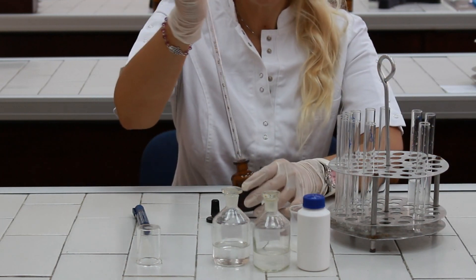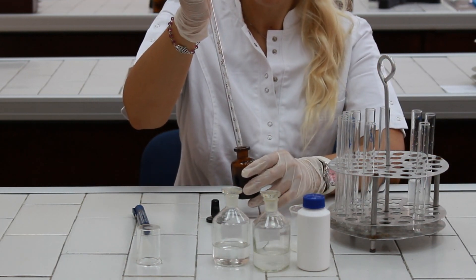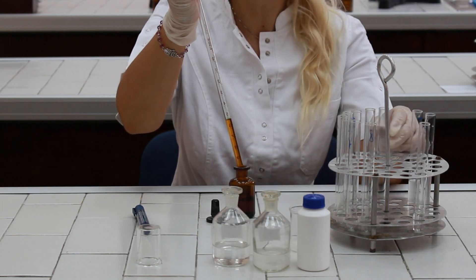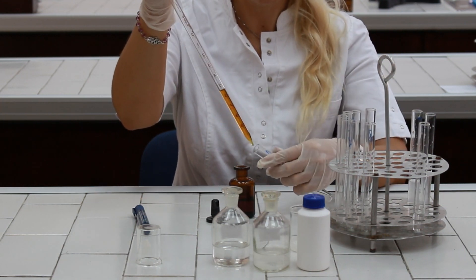And these test tubes are going to be our test tubes in which we are going to follow the degradation of starch.